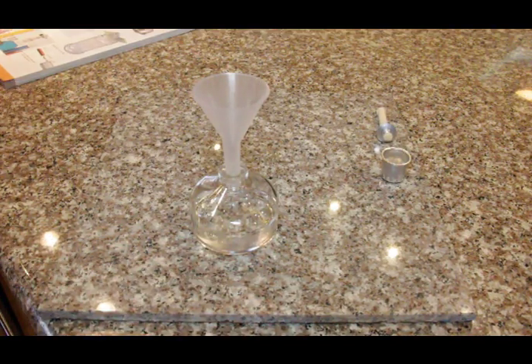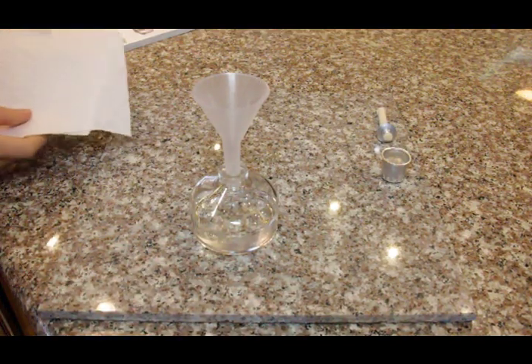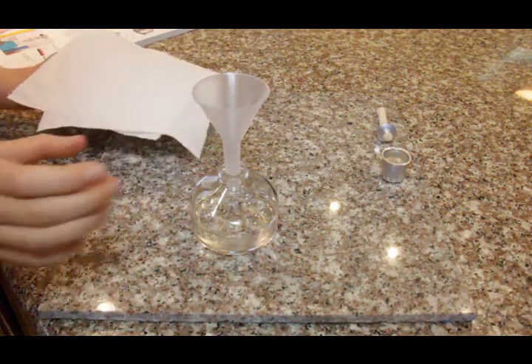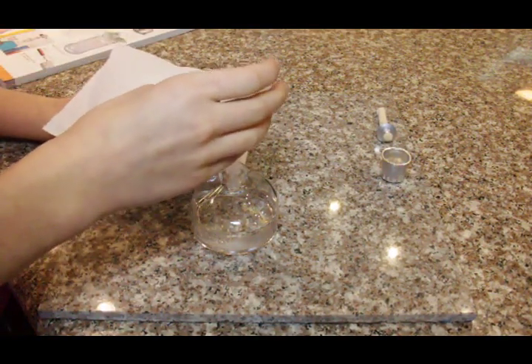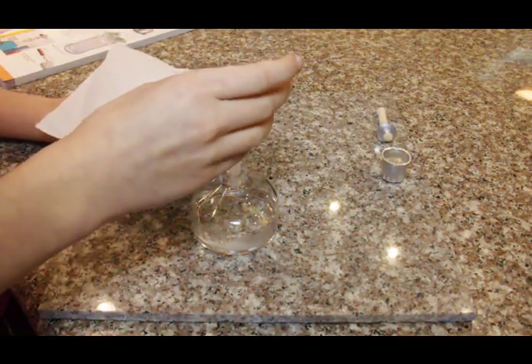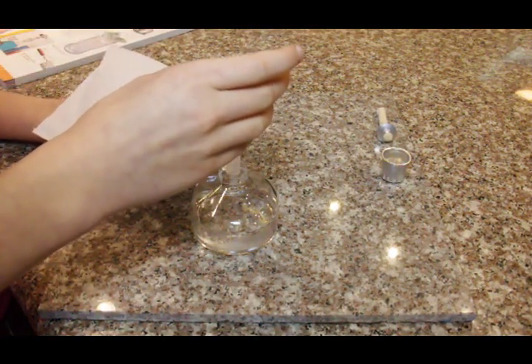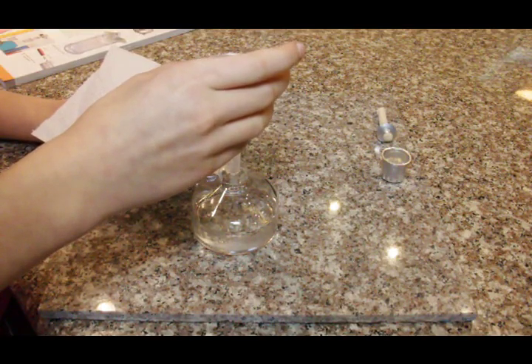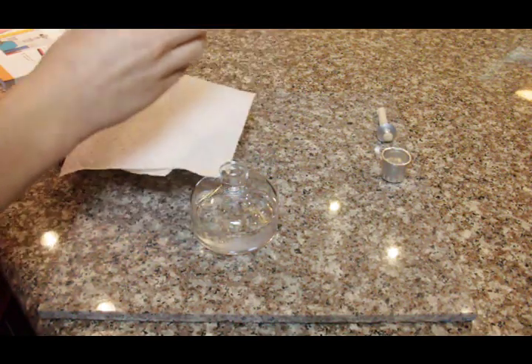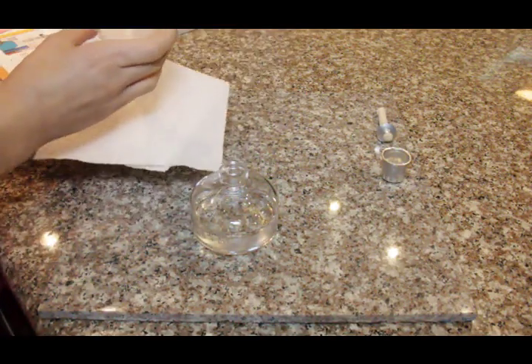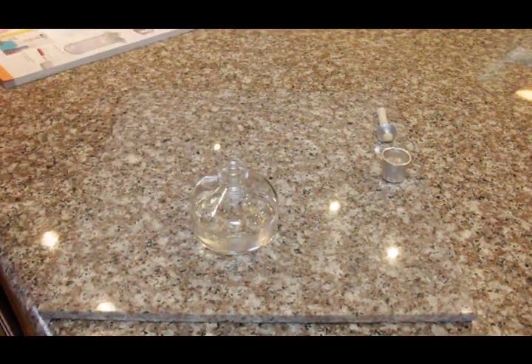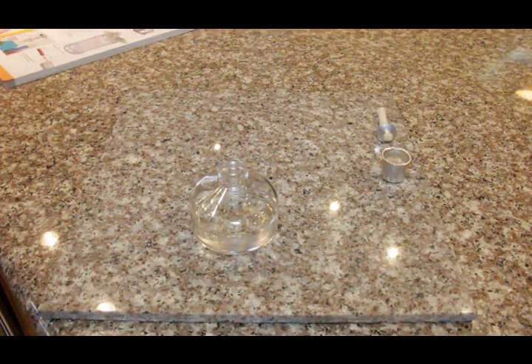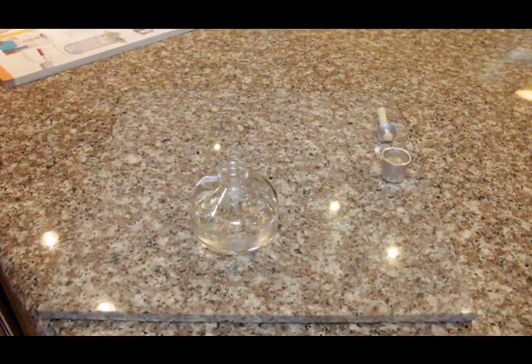To remove the funnel, you will want a paper towel and you will want to remove it very carefully to be sure there are no drips. And just like that. And then you will need to wipe the sides of the burner base to make sure that there is no extra alcohol on it.